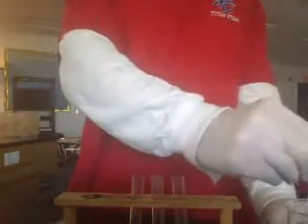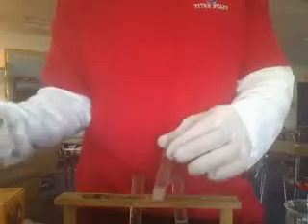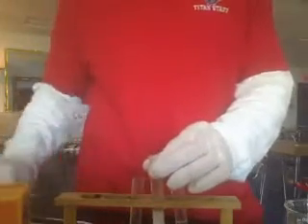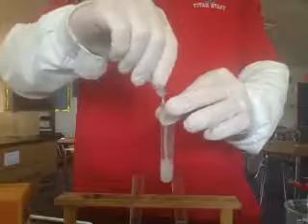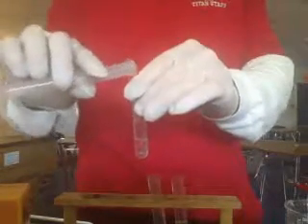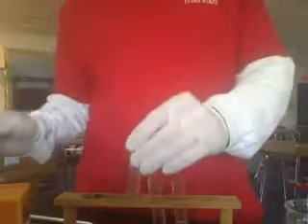And in test tube 1, I'm going to add some vinegar. And vinegar is naturally acidic, so it's going to bring the pH down. Next, I'm going to add some baking soda, sodium bicarbonate, and this is a base. You'll need to look up just exactly what the pH of baking soda is. Add that to your sheet. But I'm going to add some in there, and I want to make sure, of course, that I take a second and mix it up. I'm just going to squirt it a little bit. In the end, it should look like milk. Last, I'm just going to add plain old tap water to my solution of hydrogen peroxide. And there we go. So now I have test tube 1, 2, and 3.